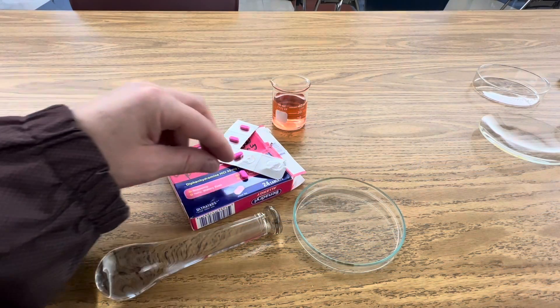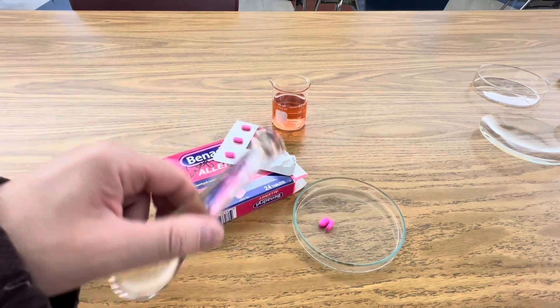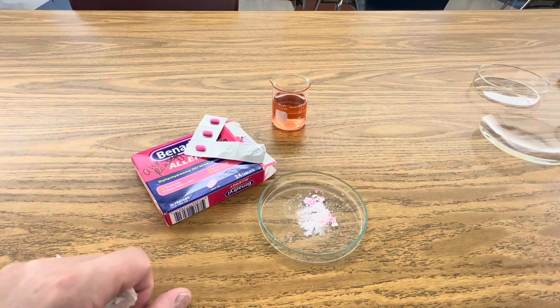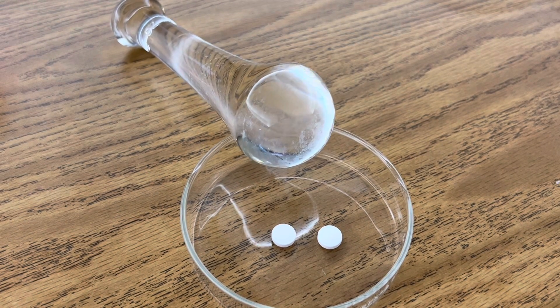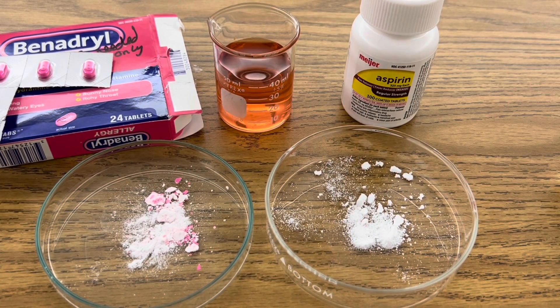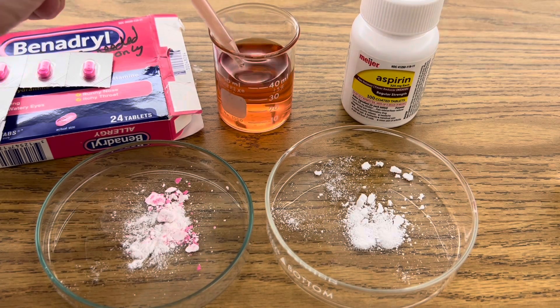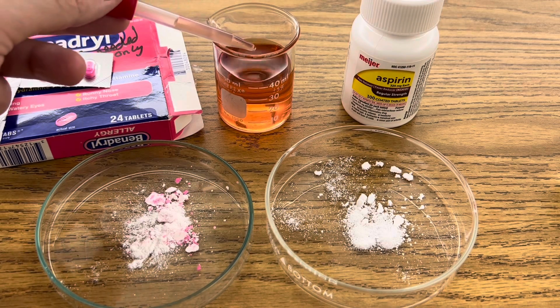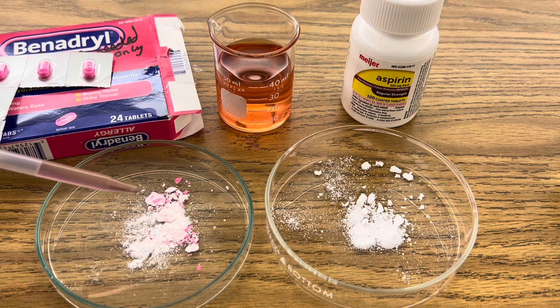So to perform the test, I'm going to take two Benadryl, put it in my petri dish, and I'm going to crush these pills with my pestle. Here's my crushed tablets of Benadryl. Next, I'll crush two tablets of aspirin. Now it's time for the Scott test — I'm just going to put a drop of my cobalt thiocyanate on each powdered pill. Over here I have the Benadryl. If it changes blue, that's a false positive. In the presence of cocaine it would also turn blue. So let's see if it turns blue.